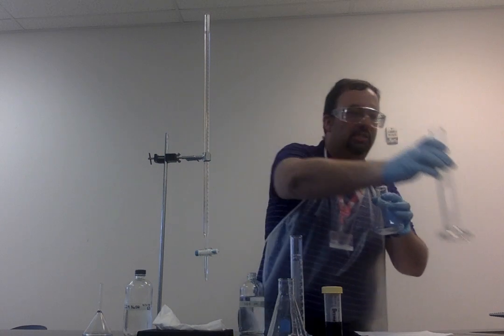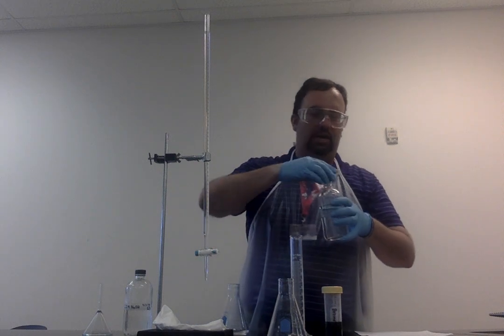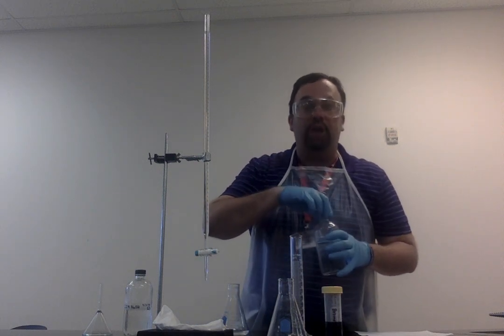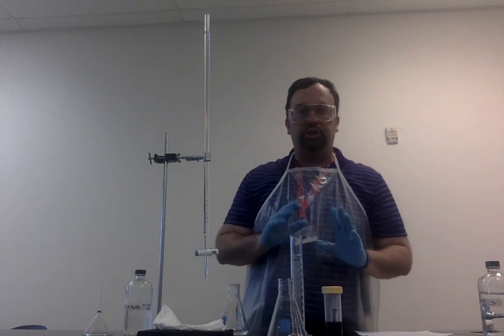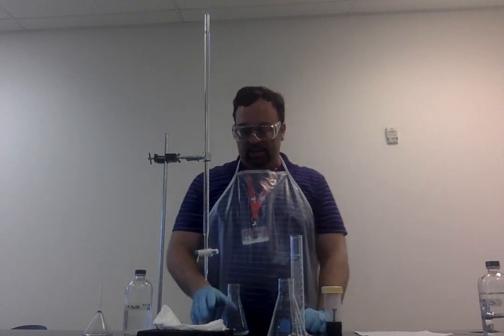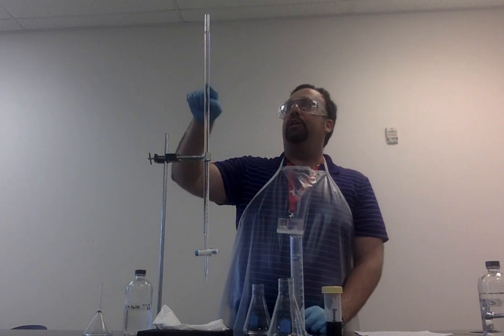I'm going to put this off to the side. I do happen to know the concentration, and so at the end I will reveal what the actual concentration of this unknown was. All right, now we have our HCl, we have our NaOH in here.